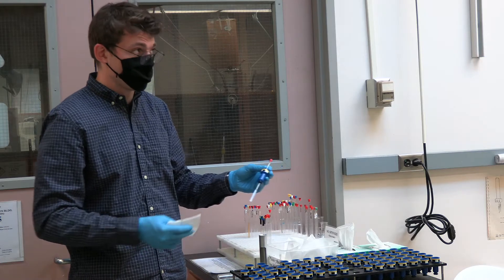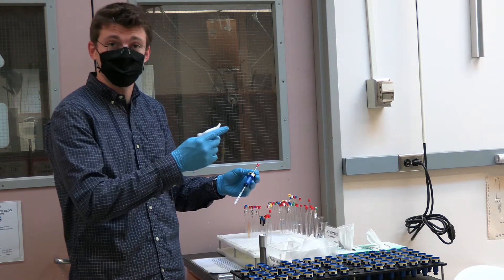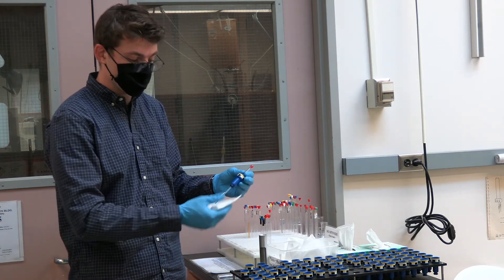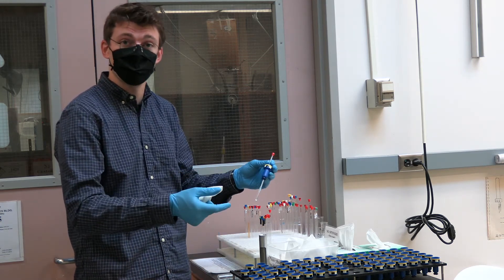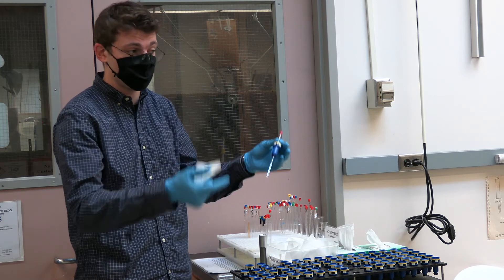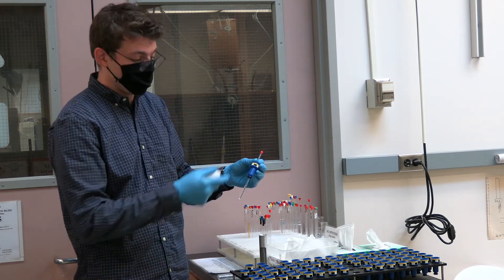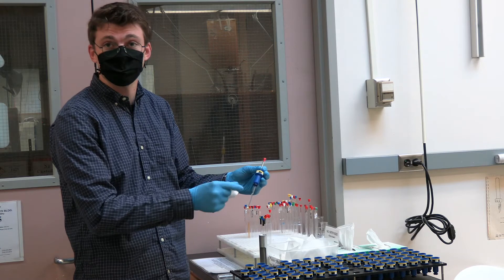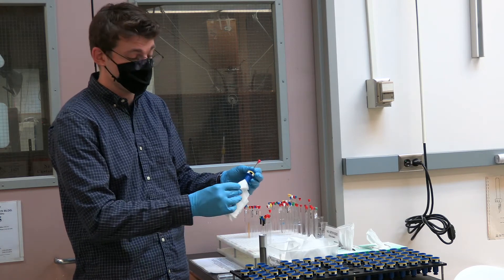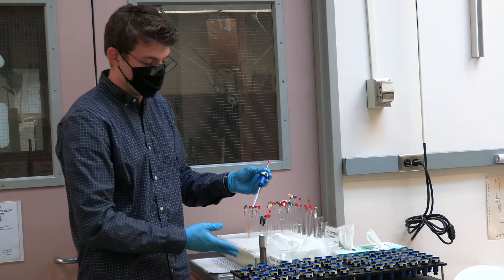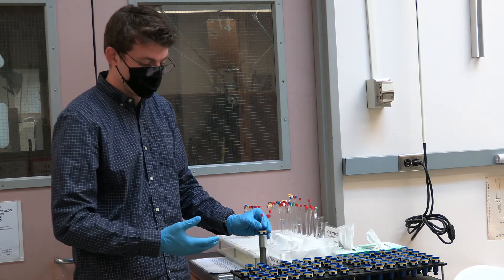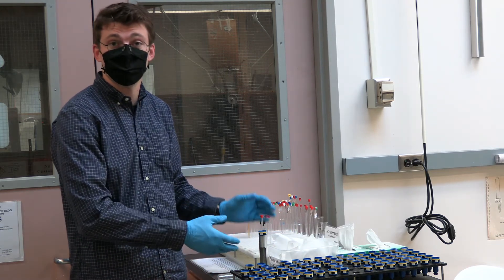So the last step for placing your NMR tube up on the carousel is to clean off the NMR tube. The insides of the spinners tend to accumulate dust and oil from people's fingers that can then be transferred to the outside of your tube. You can wipe down your NMR tube with one of the provided chem wipes ensuring not to change the position of the spinner and dispose of the chem wipe in the receptacle. Lastly I will typically double check that the position of the tube did not change.